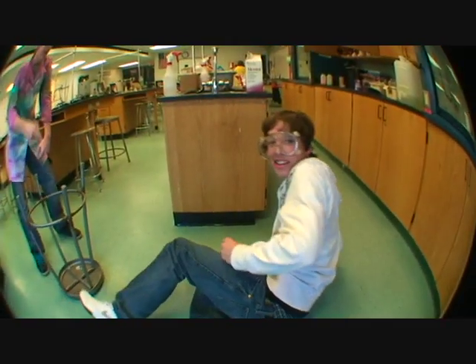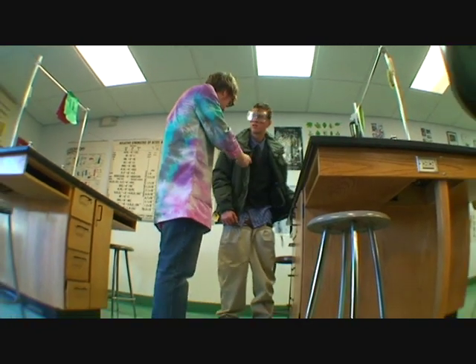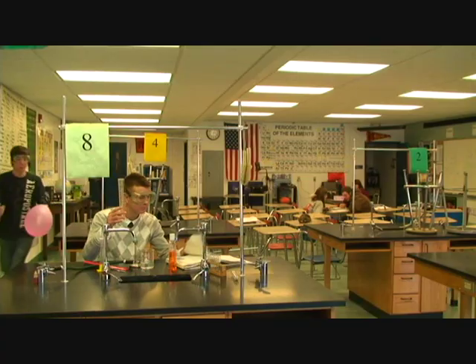See what happens when you stand on two legs on your stool? Bad things. I'm calling your mother. Excuse me, Mom. Is that baggy clothes in the laboratory? That is not allowed. Baggy clothes are not permitted when trying to light fires.